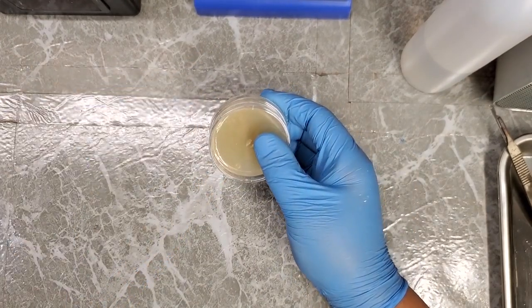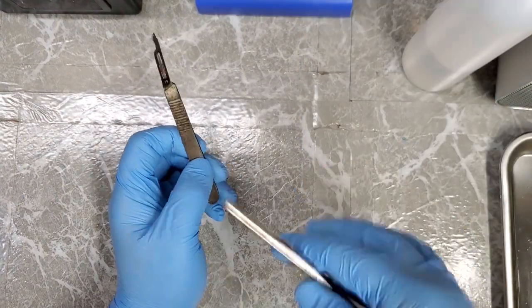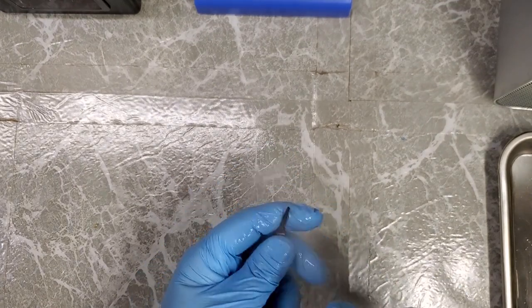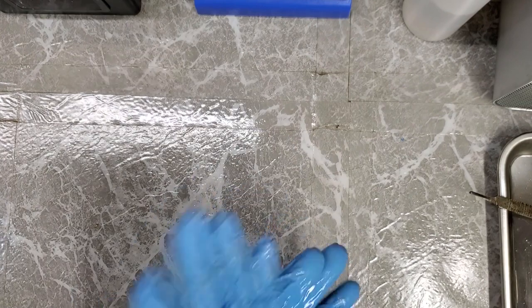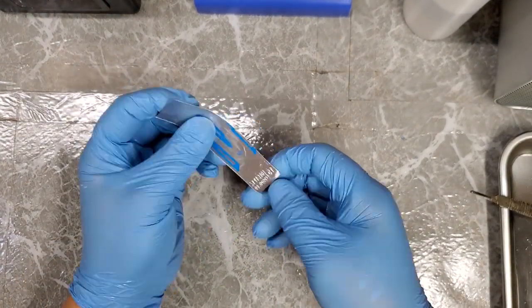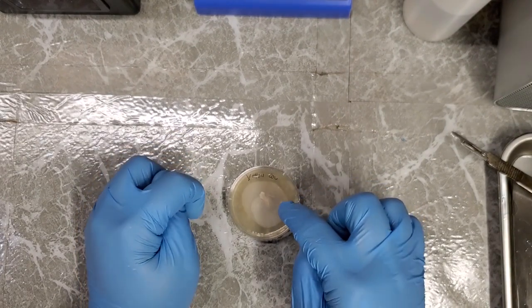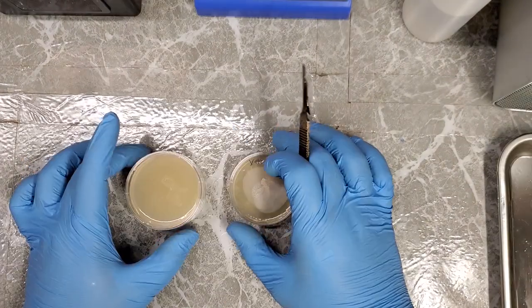I can move my parasol one off to the side too. I'm going to take this off now. I'm going to put a new blade on here, a new sterile blade. First, before I do, let me do this. I'm just going to do the procedure the way I normally would do it. So let me get another blade. This is the one that we're going to actually try and salvage. So I'm not going to really talk about this while I'm doing it. I'm just going to do it. All right, here we go.